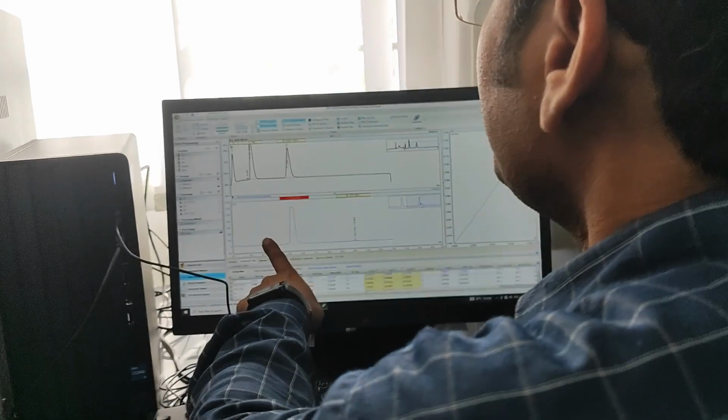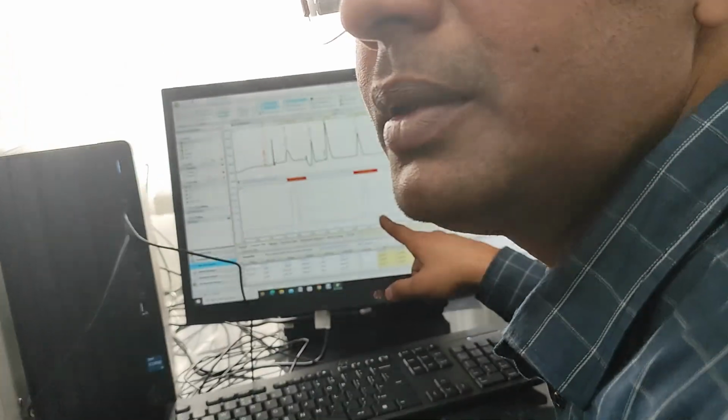That is TCD or FID? Here you are not getting any peak in TCD, so you have to report in FID. Yes. Methane is saturated here, and we will report it in FID if it is at the ppm level, right? That's why we have deleted it.